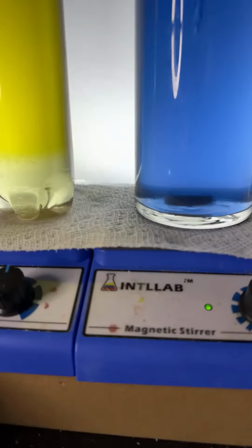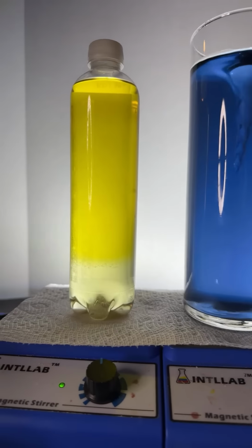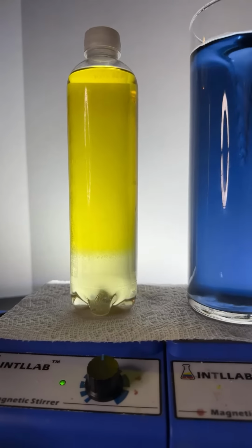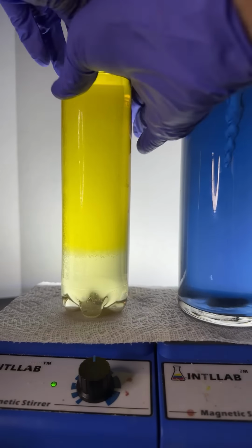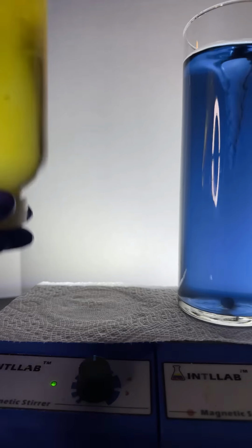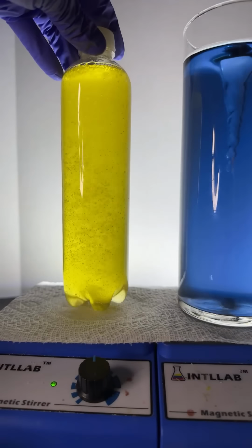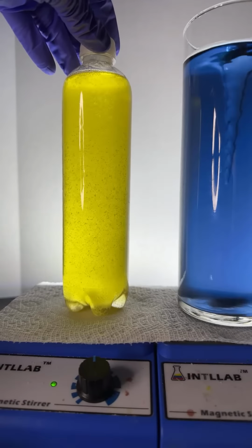Let's switch this back around. Let's add some acid or base to this bottle right here, all right? And we're going to see what happens, okay? Yeah, we hit 1,500 there for a second. Boy, it's taking a while to separate. I wonder if it's because I just don't quite have enough salt in there, or maybe the water's not warm enough. The separation's going kind of slow here.